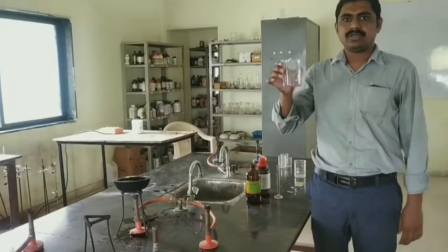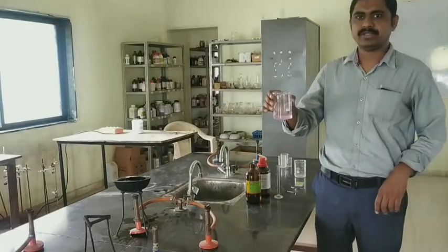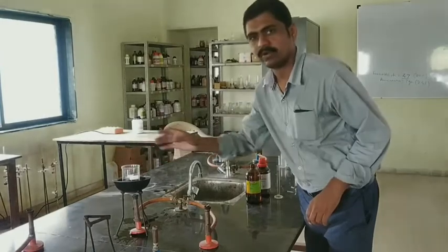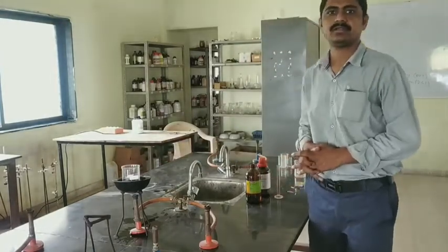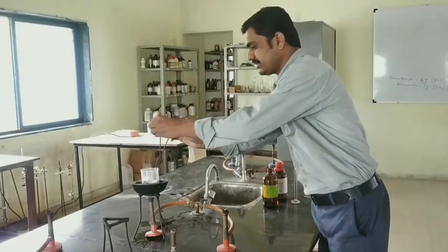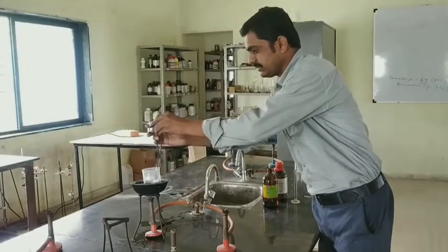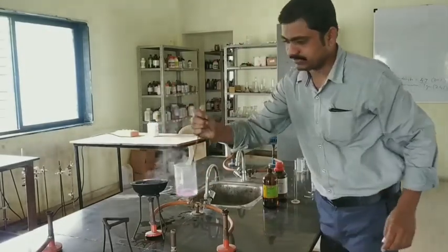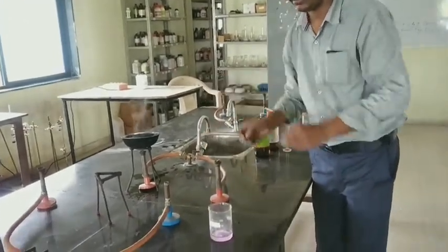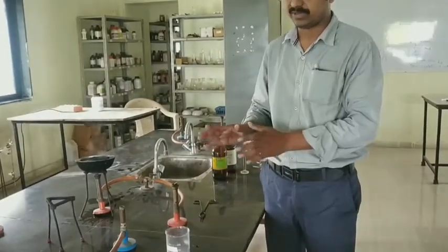This is the mixture of formaldehyde and ammonia. This mixture is heated for 5 minutes in the water bath. After heating for 5 minutes, the reaction is complete. Then keep this solution aside for 15 minutes.